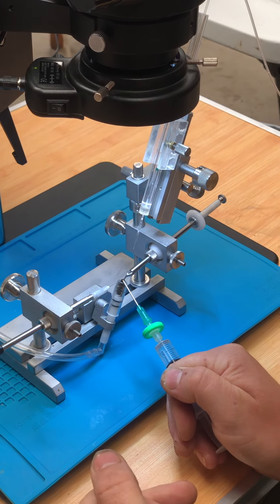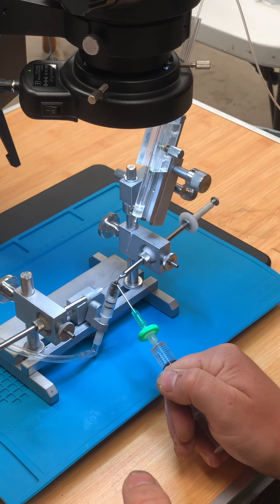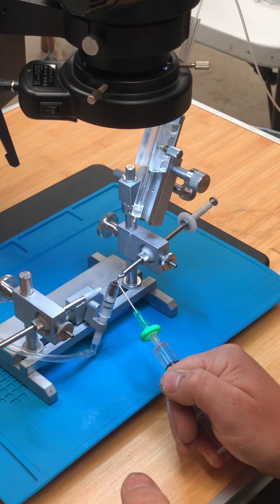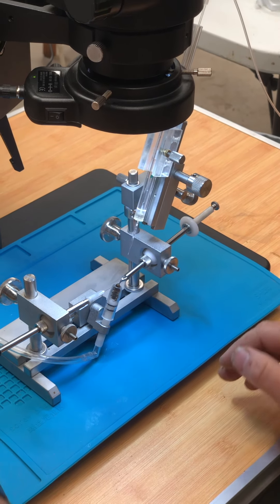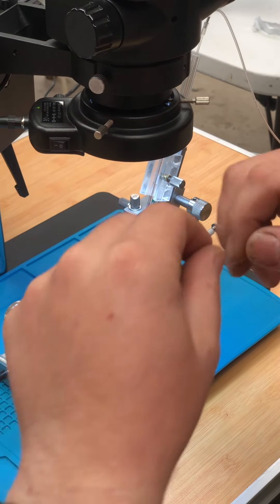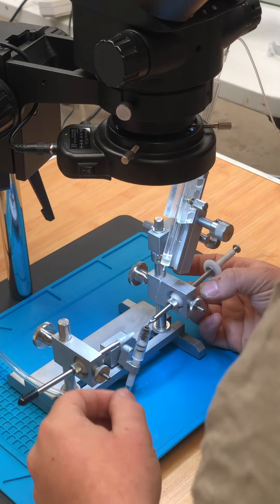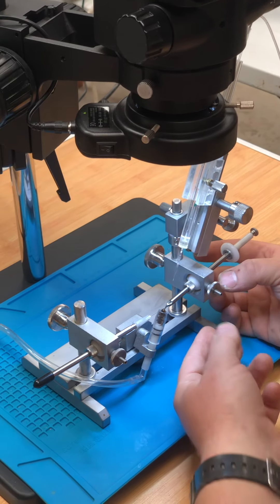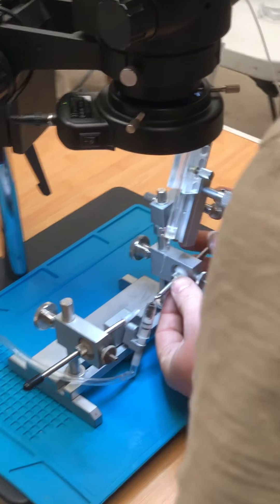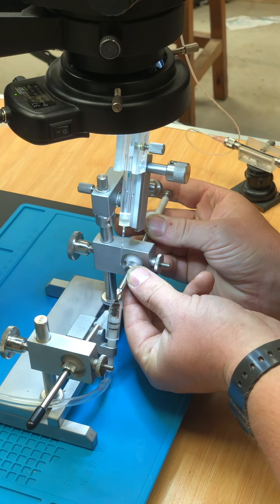So you've just got to be aware that we're operating quite close to the queen holder, which will limit how far down you can go. The idea is not to push her down to get her open — it's just to try and work nice and gently. Once you've exposed the sting, she'll stay open a bit; you just want to open the sting forceps, reach forwards and grab the sting.